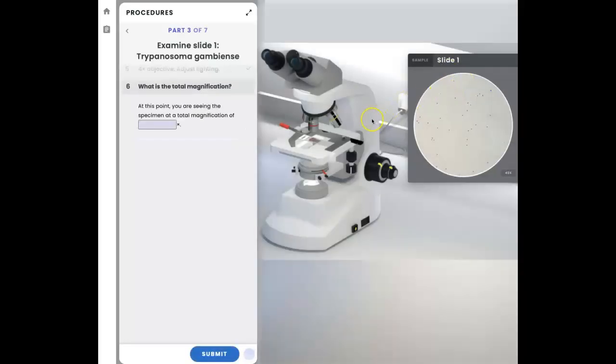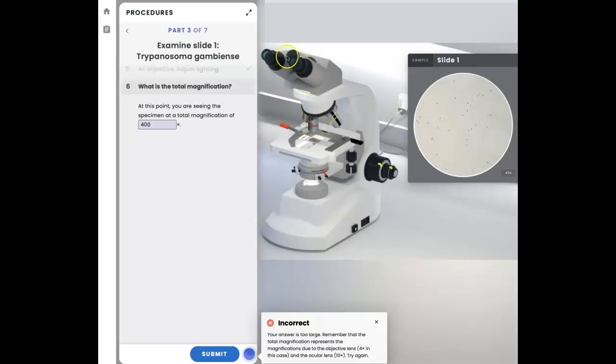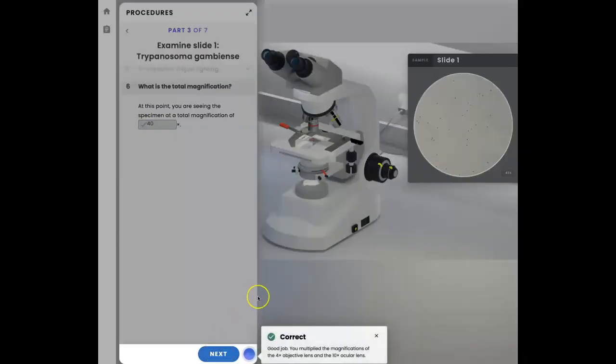Now let's see what is it. So 4 times 10, which is the magnification of the ocular. So this is the objective, this is the ocular, that gives you 40. So let's fix that and resubmit. And the feedback tells me that I'm correct. So let's go to the next step.